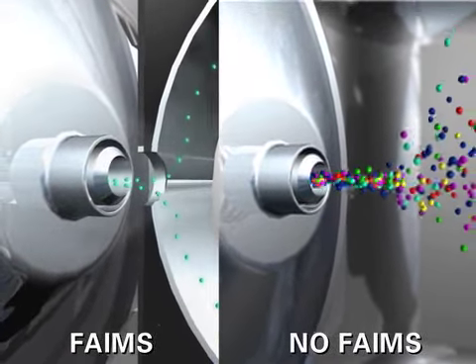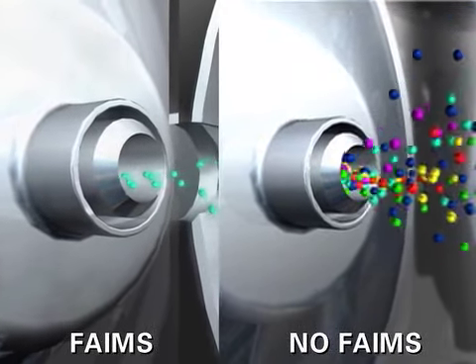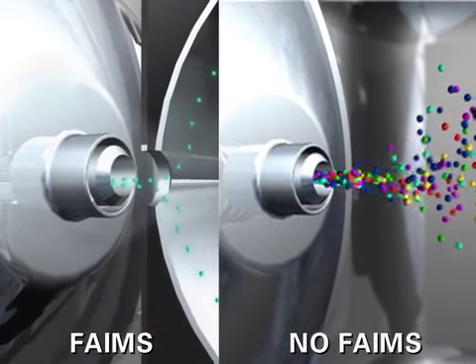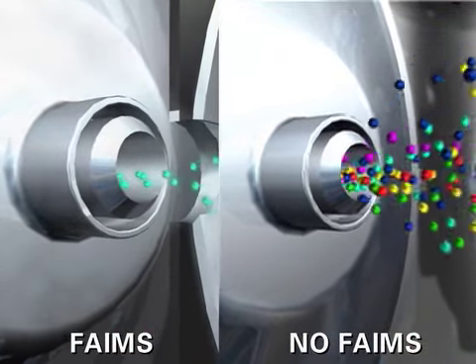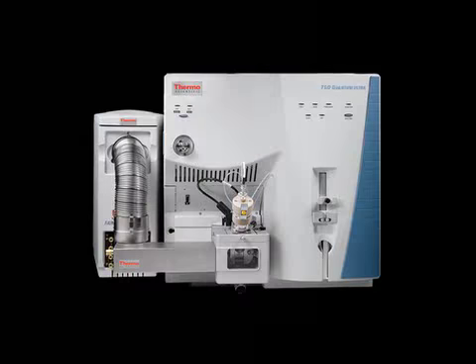Since only the ion of interest is passed into the mass spectrometer, it leaves the mass spectrometer's components cleaner. The goal is to get the greatest selectivity possible, and that's what FAIMS offers. So when you combine it with heated electrospray and HSRM, you get the greatest selectivity in your bioanalytical assays.